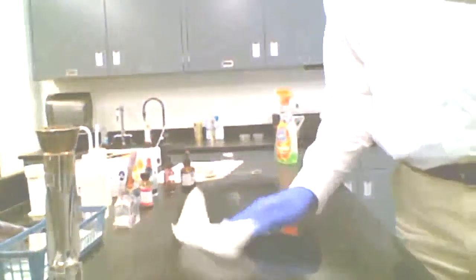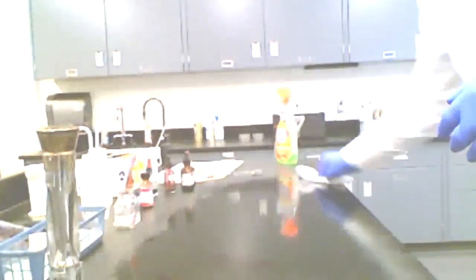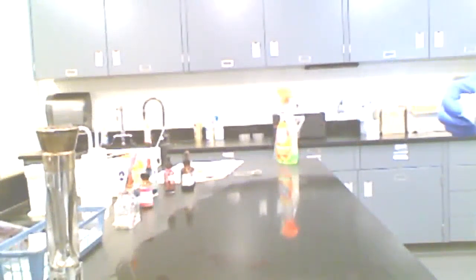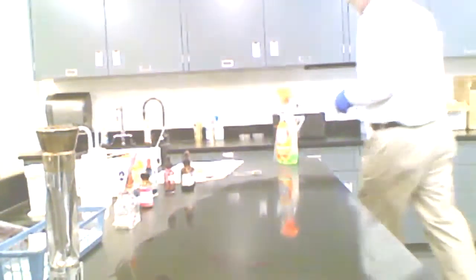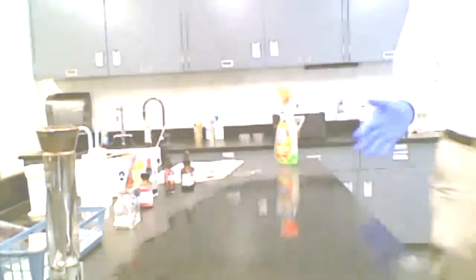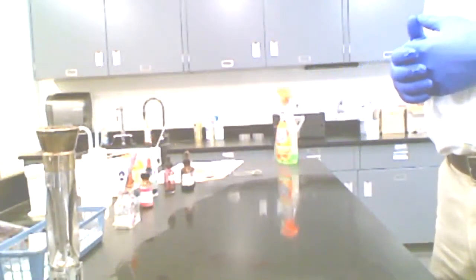Notice I'm wearing gloved hands. I'm wearing gloves on my hands, and that's something we want to try to implement as well. All right, so I'll let that dry, and I'll have an area here where I can work and be reasonably confident that organisms have been reduced adequately. So that's the first step. We'll wipe down when we come into the lab. We'll do our work, and when we finish, we want to make sure and wipe down as well. We want to disinfect.